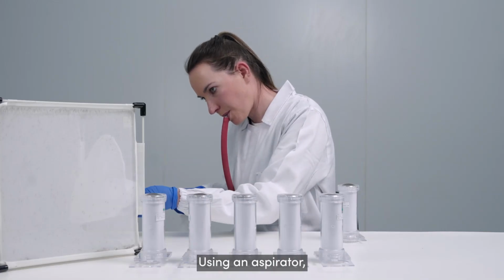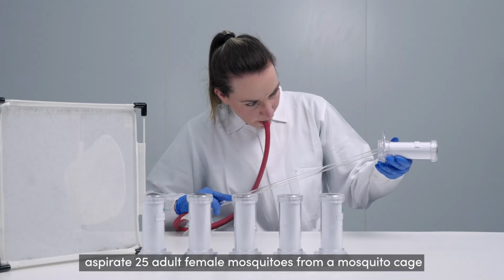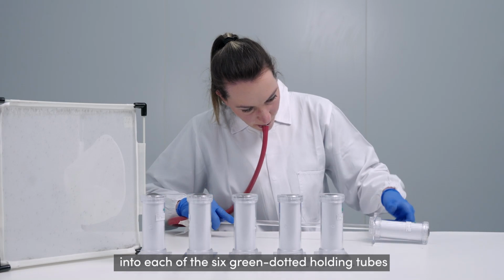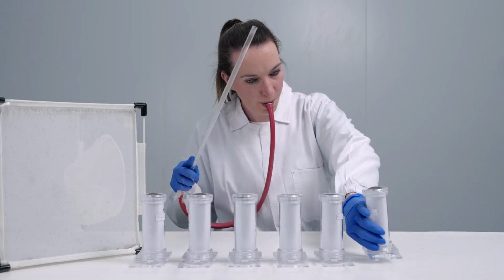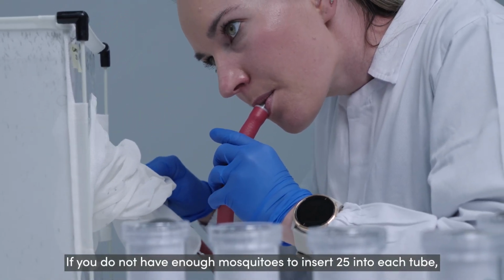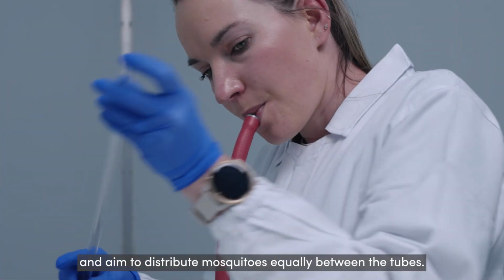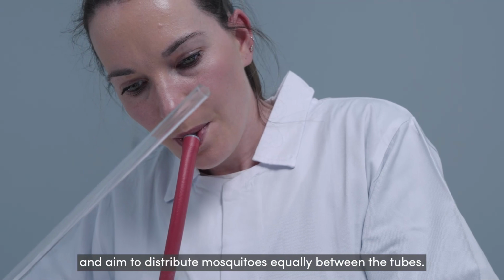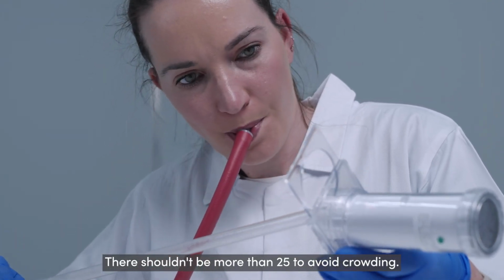Using an aspirator, aspirate 25 adult female mosquitoes from a mosquito cage into each of the 6 green dotted holding tubes through the filling hole on the tube sliding door. If you do not have enough mosquitoes to insert 25 into each tube, keep the number as close as possible to 25 and aim to distribute mosquitoes equally between the tubes. There shouldn't be more than 25 to avoid crowding.